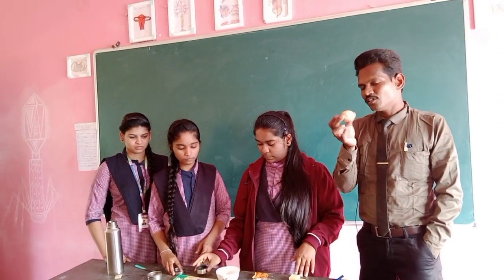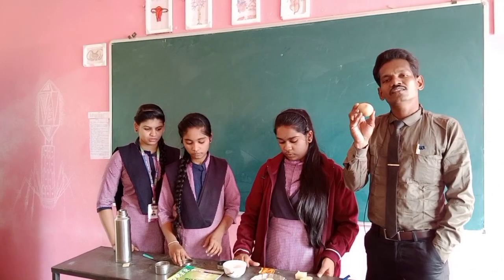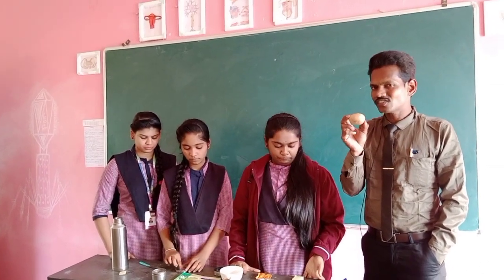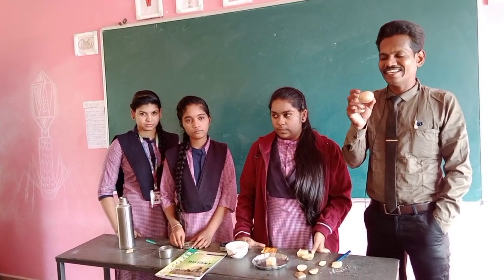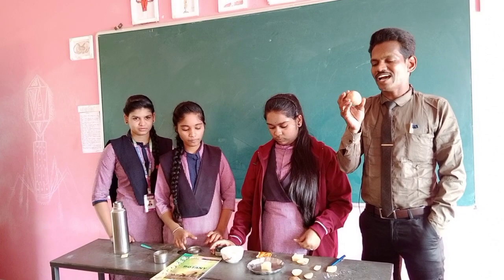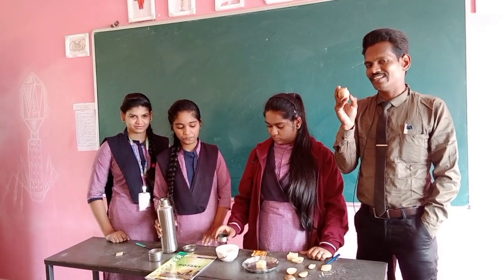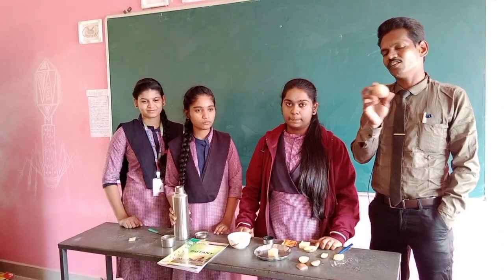Raw potatoes must be taken. Why? Because if we take a boiled potato, the plasma membrane will be dysfunctional. Once we boil or disturb or dry any substance, cell, fruit or vegetable, the plasma membrane will collapse. Then osmosis or permeability will never take place.